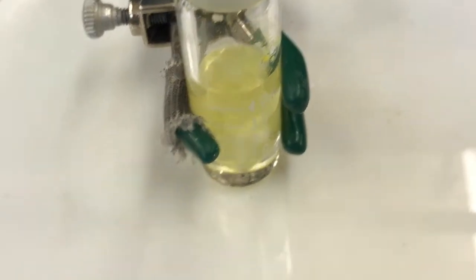I'm gonna do a little bit more and then we're gonna do something else. Let's see, where is our TLC plate? There we go. I'm gonna next spot the, let me make sure. I forget where I'm at because the numbering's all off. This experiment's gonna go well though still. I just took my TLC plate over to the UV light box. The last one was 105, yeah. I'm gonna do a 125 and then I'll tell you what we're gonna do next.